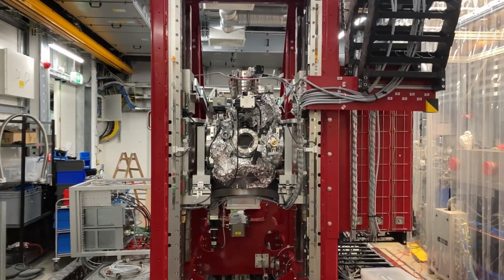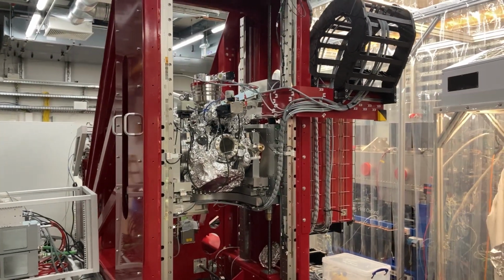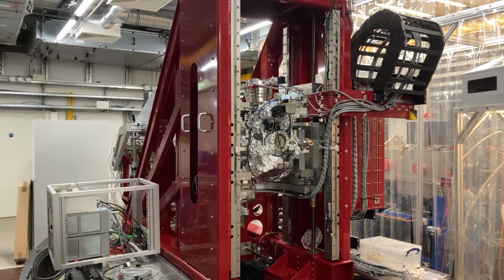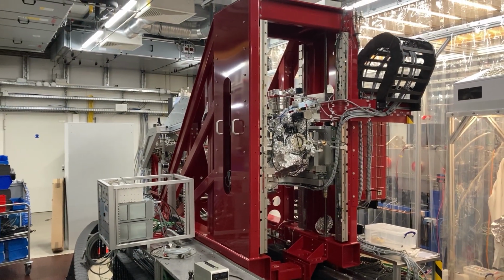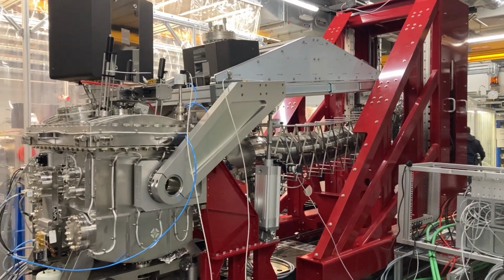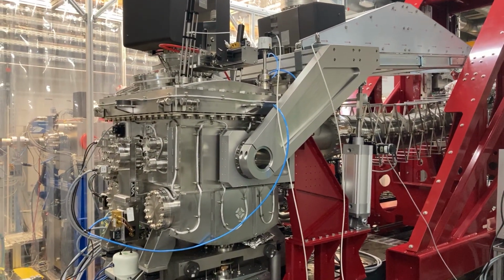The materials are composed of different atomic elements. When we use different colors of the X-rays, we can distinguish them and see the individual dynamic interplay. In this way, we can see the inner workings of the materials and we can learn how they function. This may help to design better materials for the future.